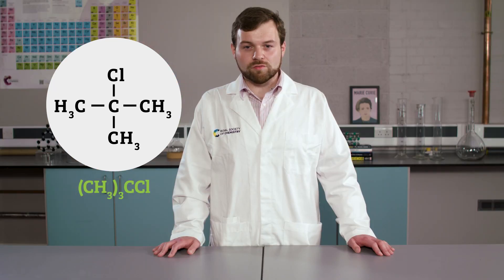Organic compounds and materials play a vital role in our everyday lives, and many chemists working in the industry are involved in their production. Today I am going to prepare a pure organic liquid, 2-chloro-2-methylpropane. This process has three key steps.